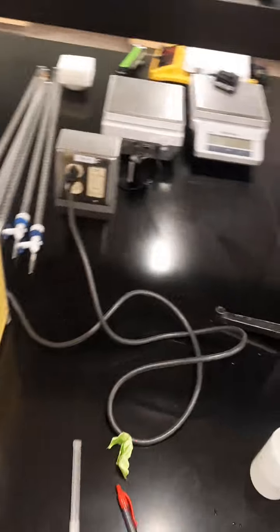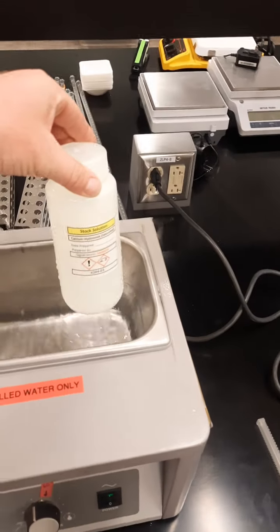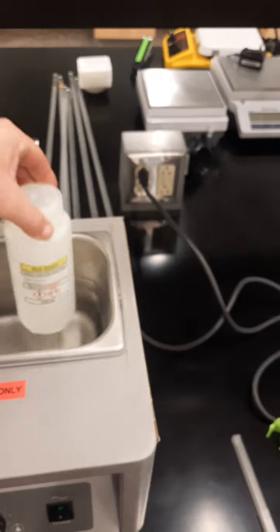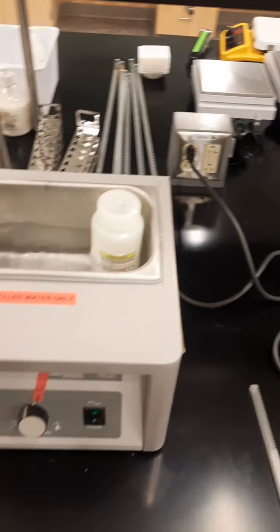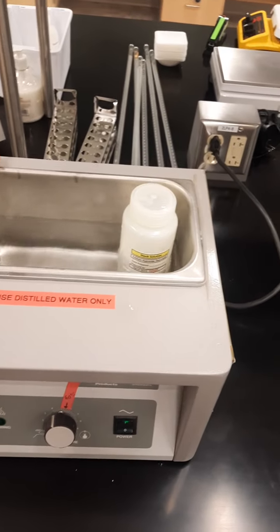On day two, the calcium hydroxide will be in a hot water bath. Please leave it in the hot water bath until the moment you need it.